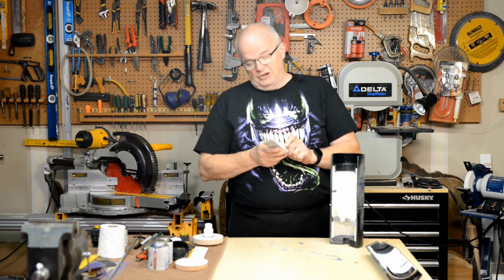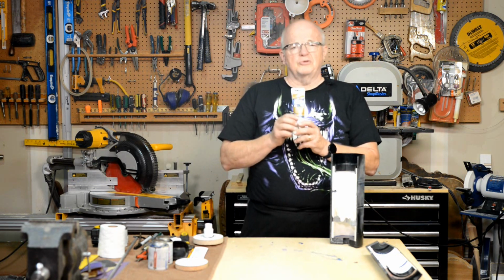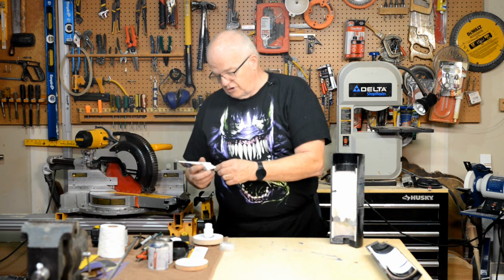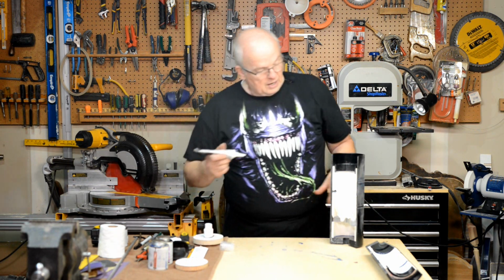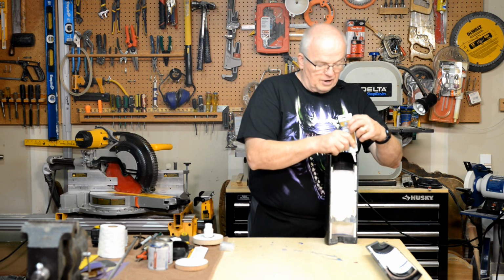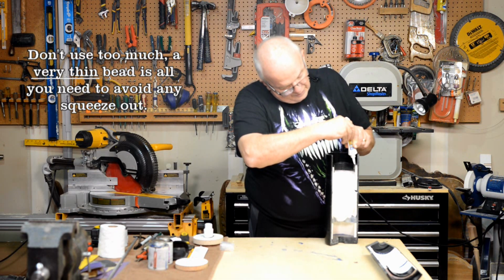This is GE's Window and Door Project's advanced silicone, 100% waterproof and 10-year mold free. But anyhow, it's just 100% silicone. You don't need a whole bunch of it. What I did was I laid a layer of this silicone down inside of this channel. You can see it dries really well. I put a small bead down inside this channel.